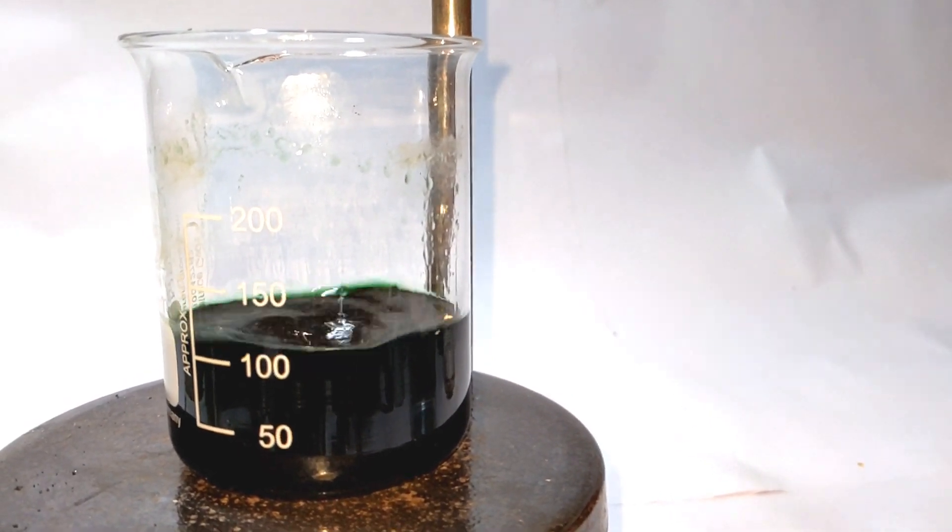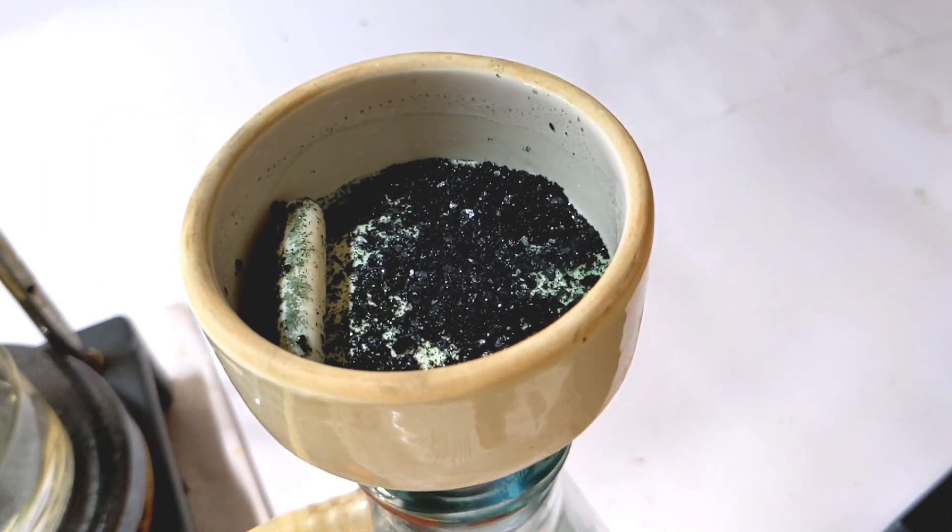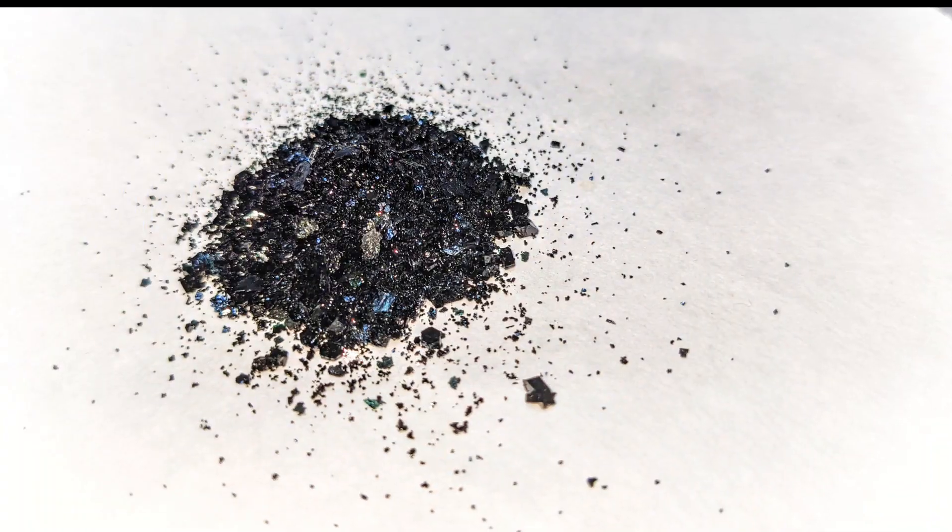And these are the crystals of the product. And this is the final yield of Tris Acetyl Acetonato Cobalt 3.